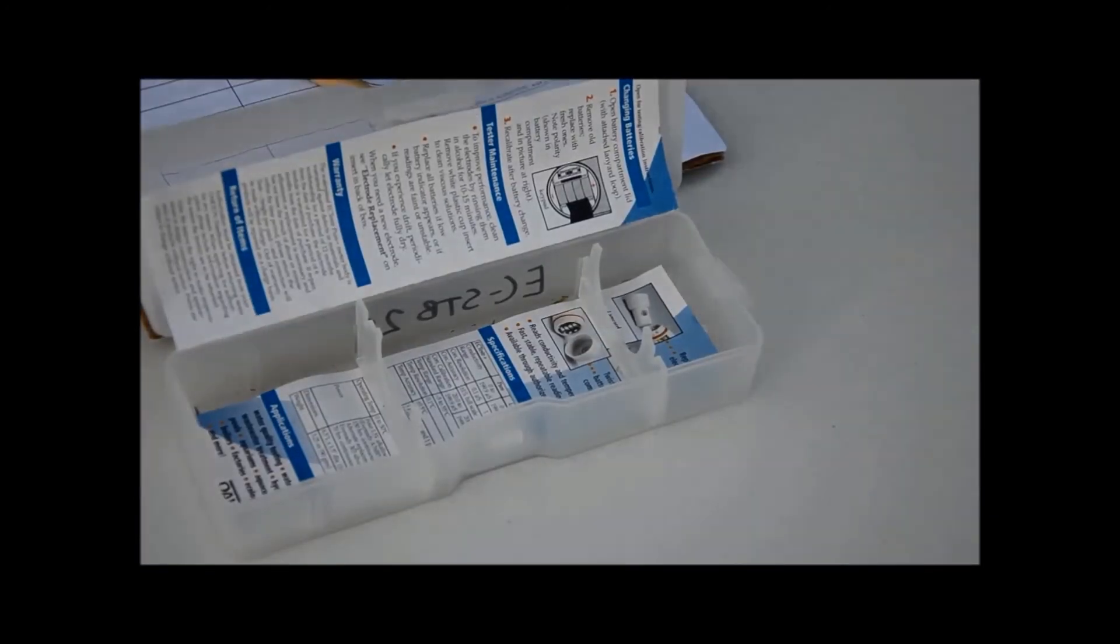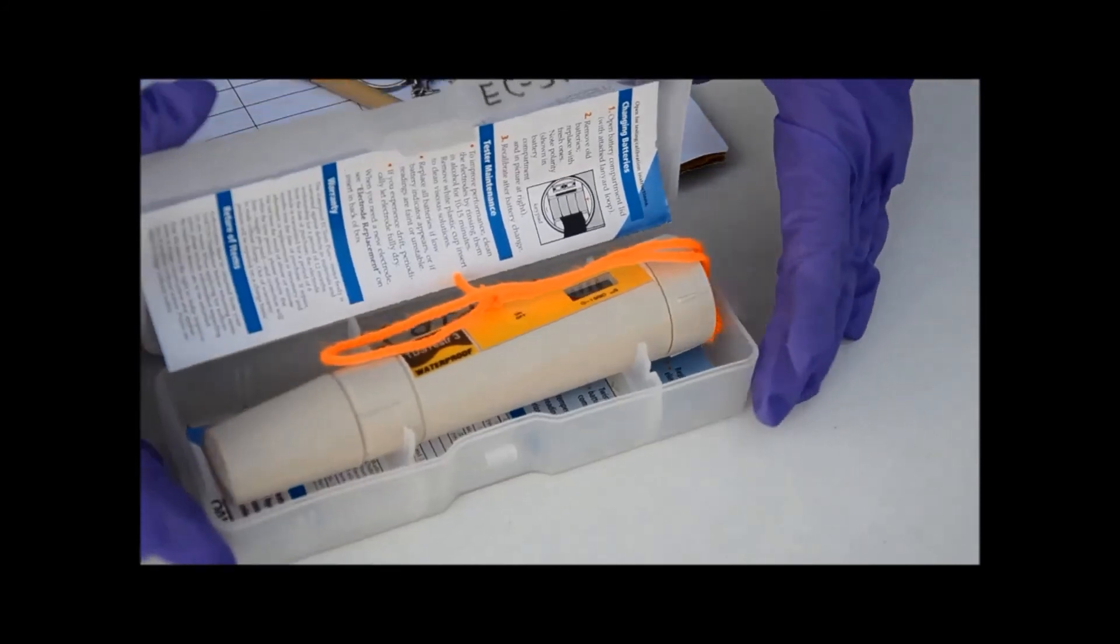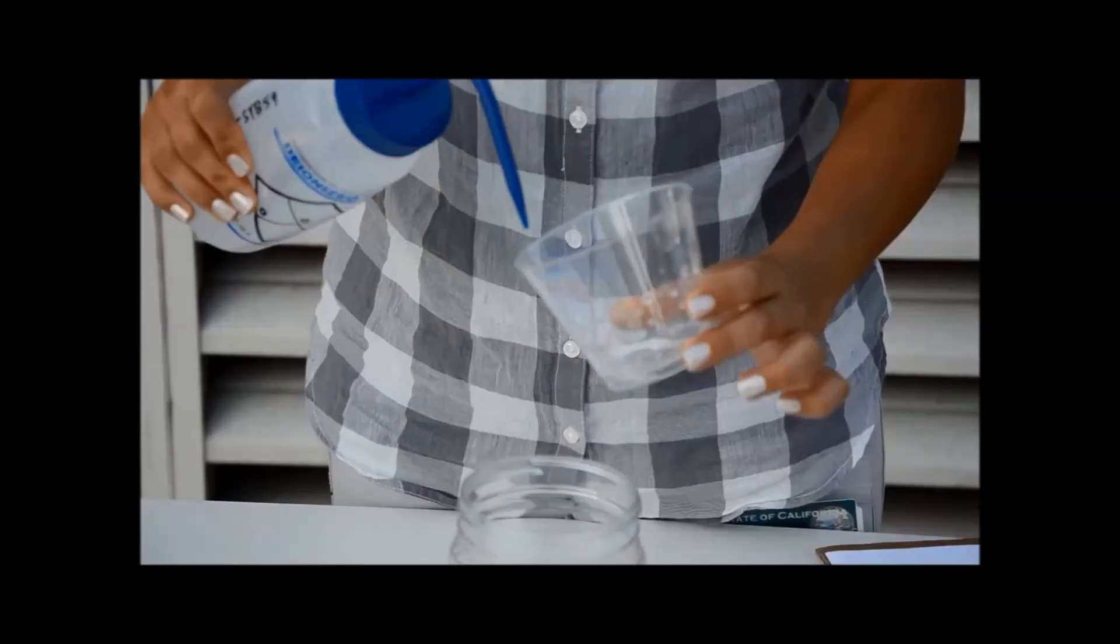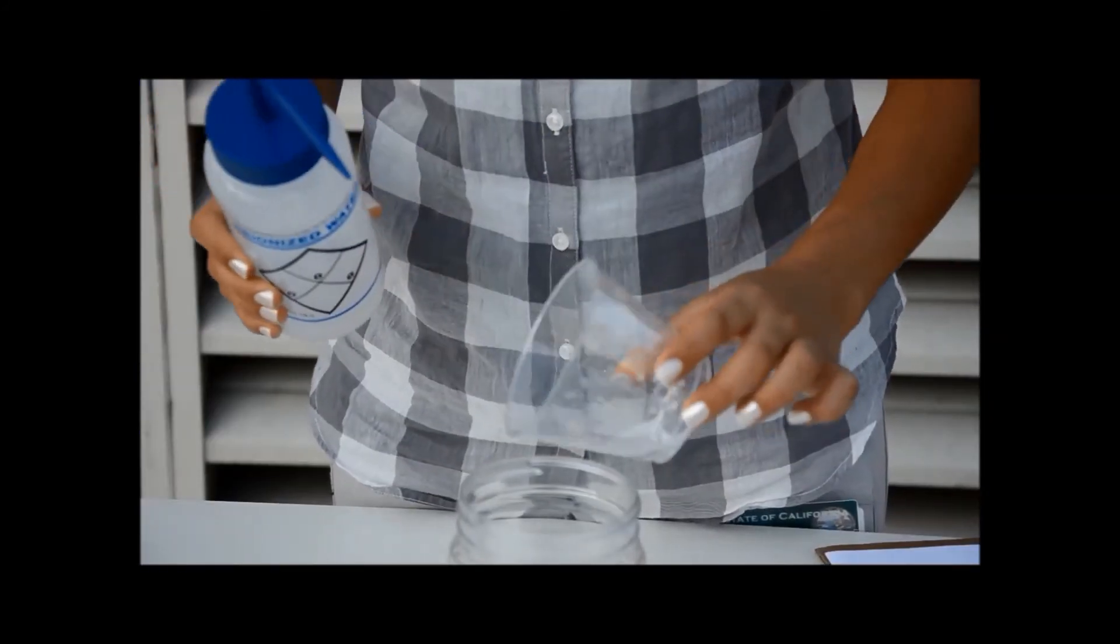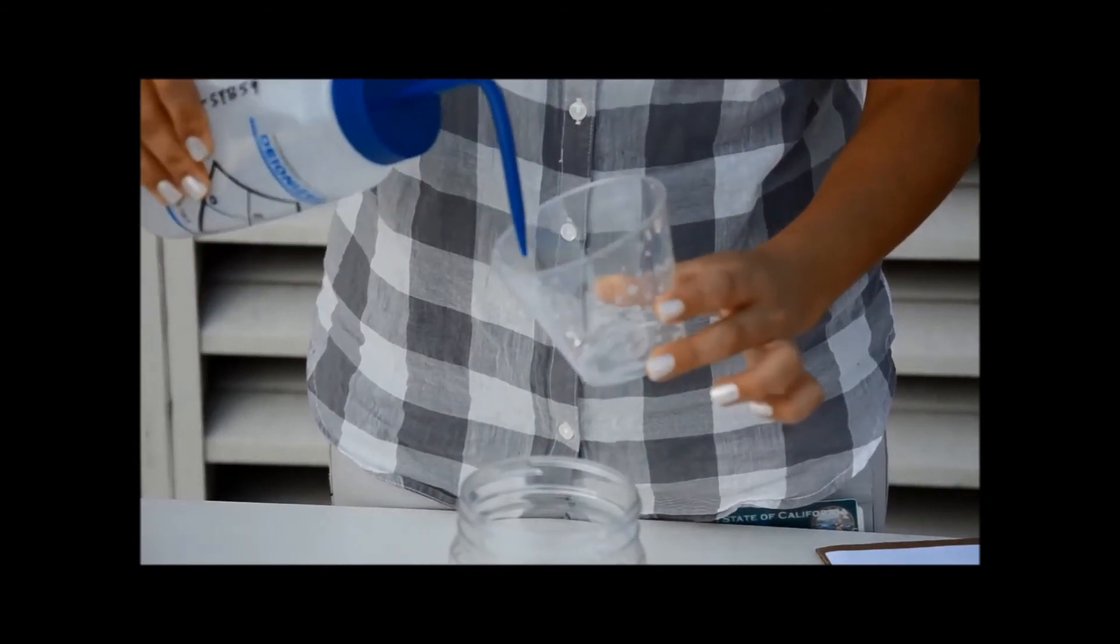Pour out your used calibration solution into the waste container and rinse out the cup that it was in. Dispose of it as per your calibration solution's material safety data sheet.